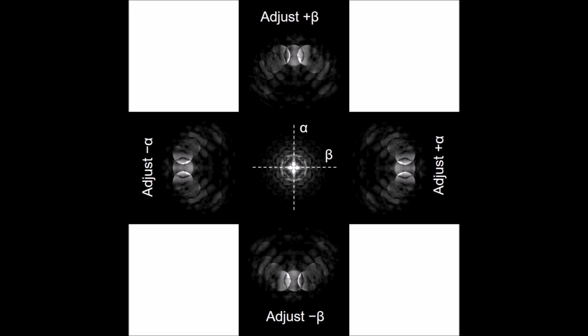All right, so this is what the final tilt map looks like. You can see it's very similar to what we saw with the map we generated in conventional mode. The only difference now is how the diffraction patterns appear. So now we have disks because we have CBED patterns, but the curvature of the disks is identical to what we saw previously. Okay, these are again obviously simulations. This was done with software called MuSTEM, which is free. You can find this if you search for it. It's fairly easy to use.